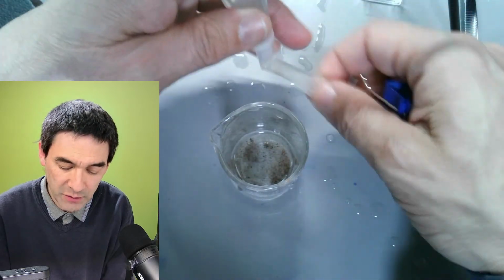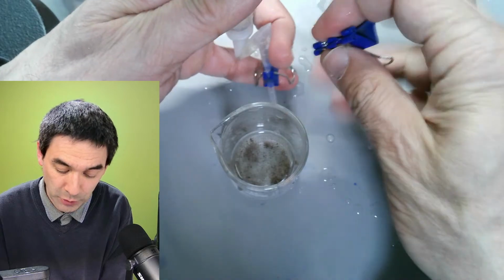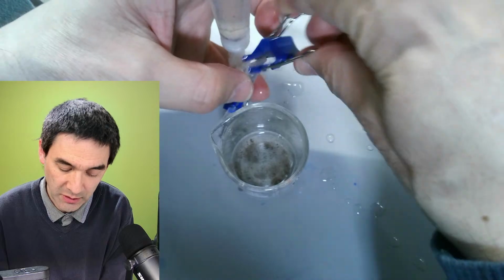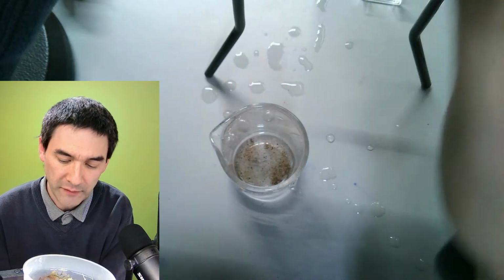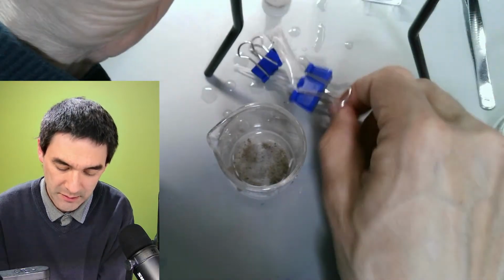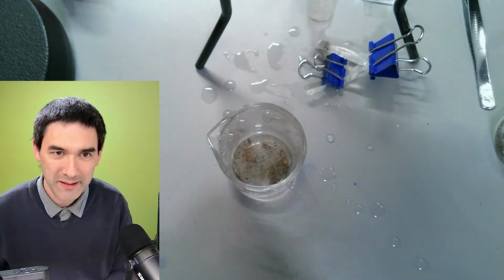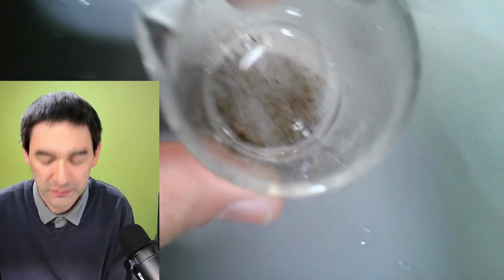This is not the way it's supposed to be, but I'll be honest with you, I had problems finding sufficiently flexible tubing. So that's why I kind of improvised it a little bit. Okay, so here we go again. It's a little bit of a mess, but this is actually what we want, right?